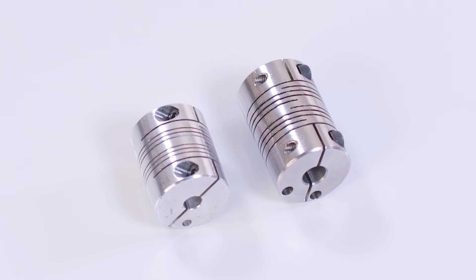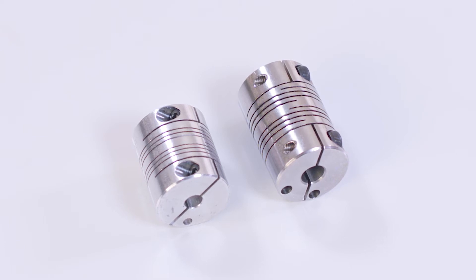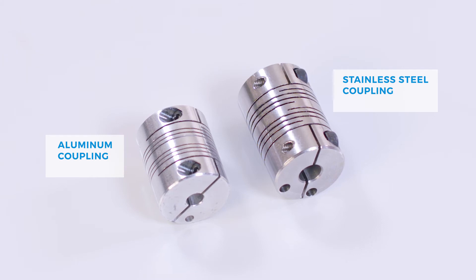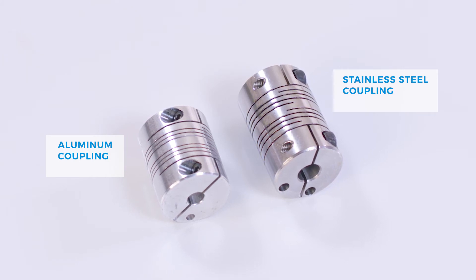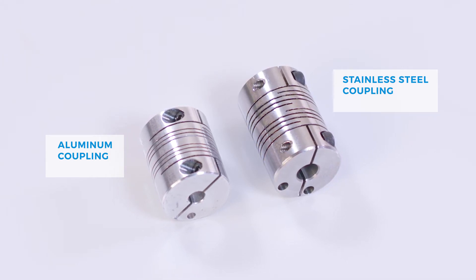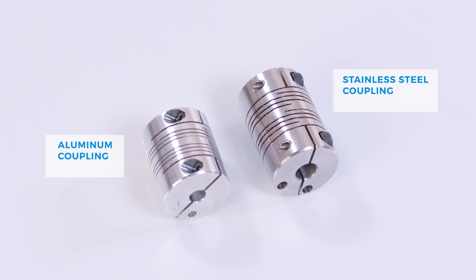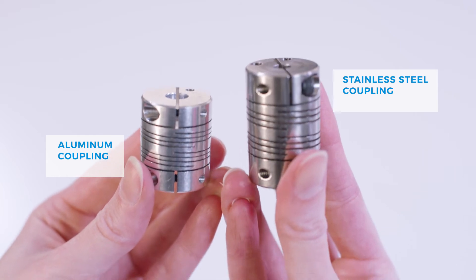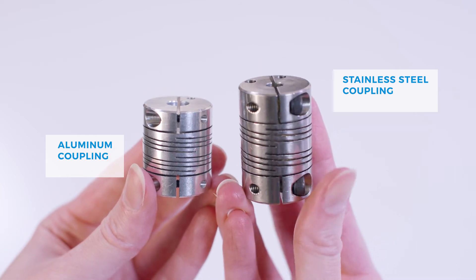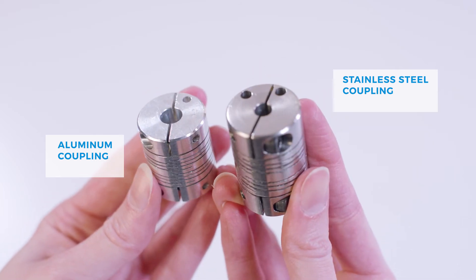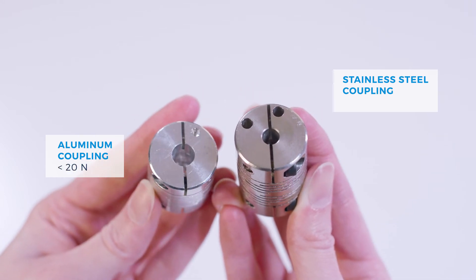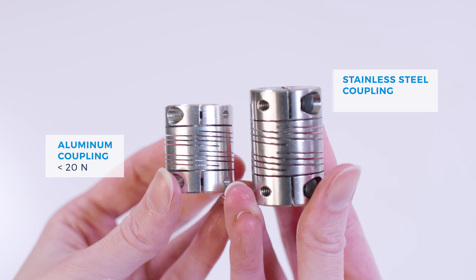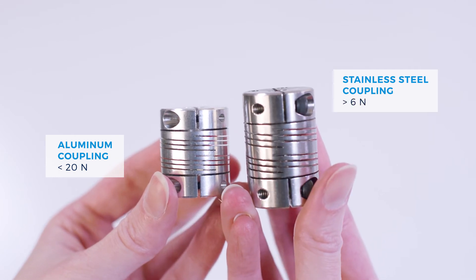In the geometry kit, there are two beam couplings, the aluminum coupling and the stainless steel coupling. These couplings are used to provide excellent alignment between the two surfaces and ensure a uniform distribution of the axial force during the measurement. In general, this aluminum coupling is commonly used for lower axial force testing, and the stainless steel coupling is used for higher axial force testing.